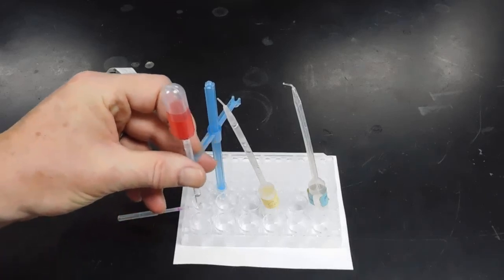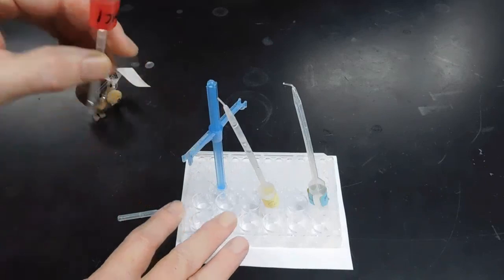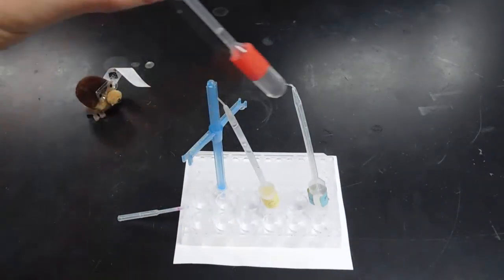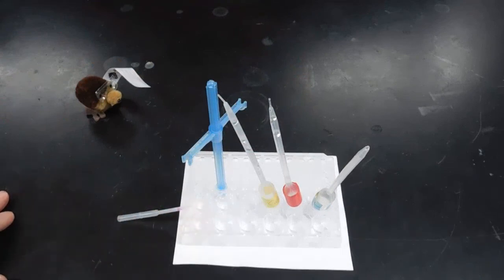To clean everything up, I just take this over to a sink with running water and shake this solution into the sink, and then rinse the well holes with distilled water and then shake dry and air dry for the next time. All that's left then are the calculations.